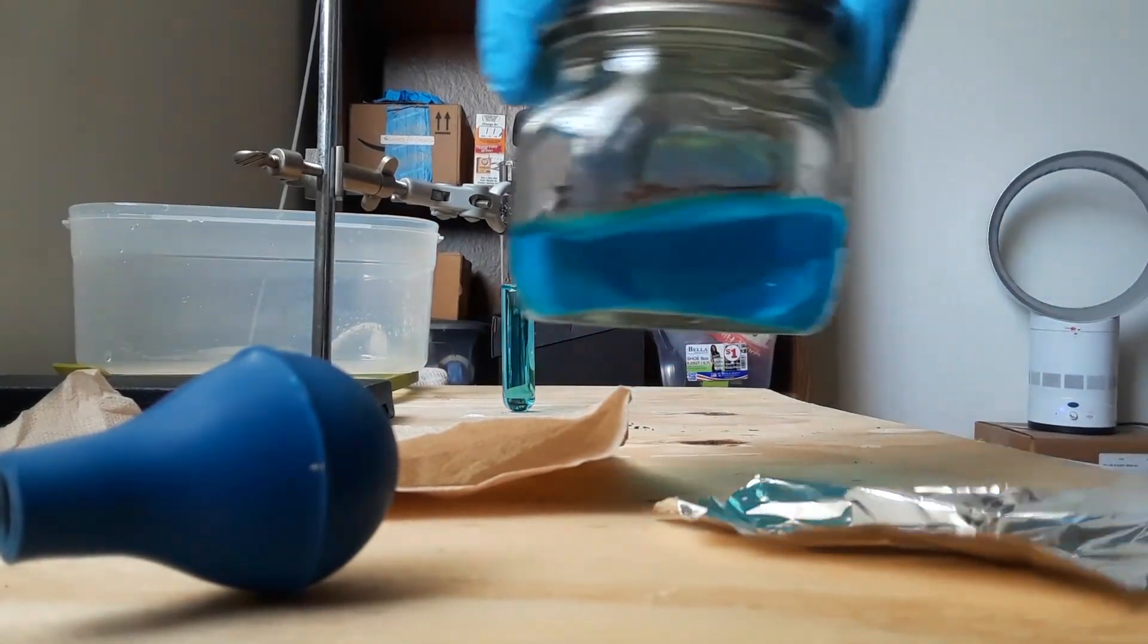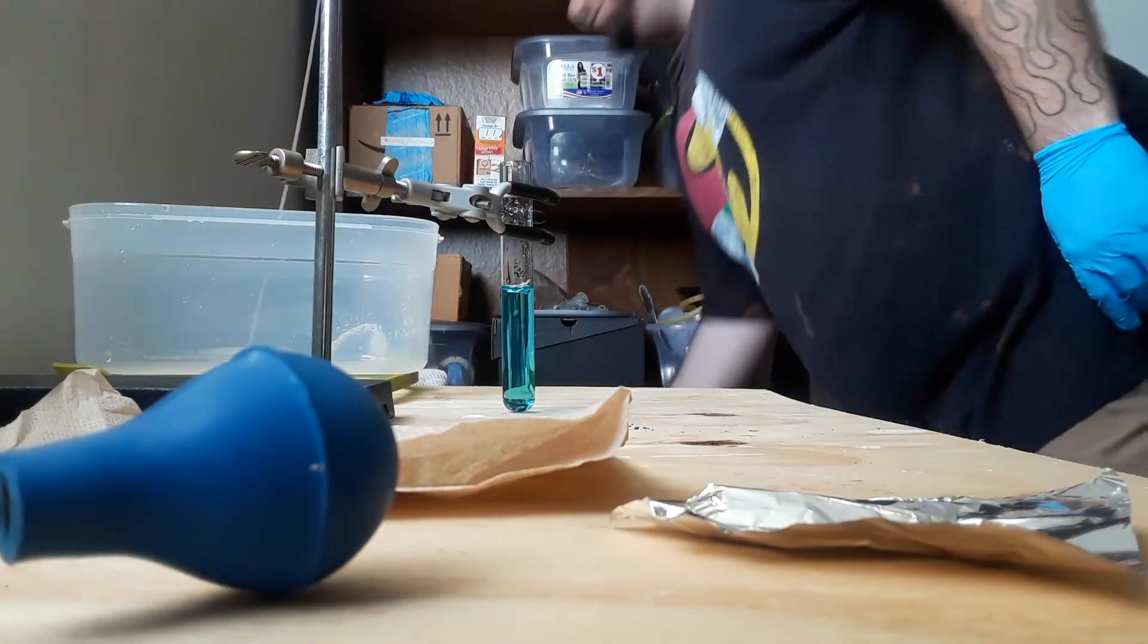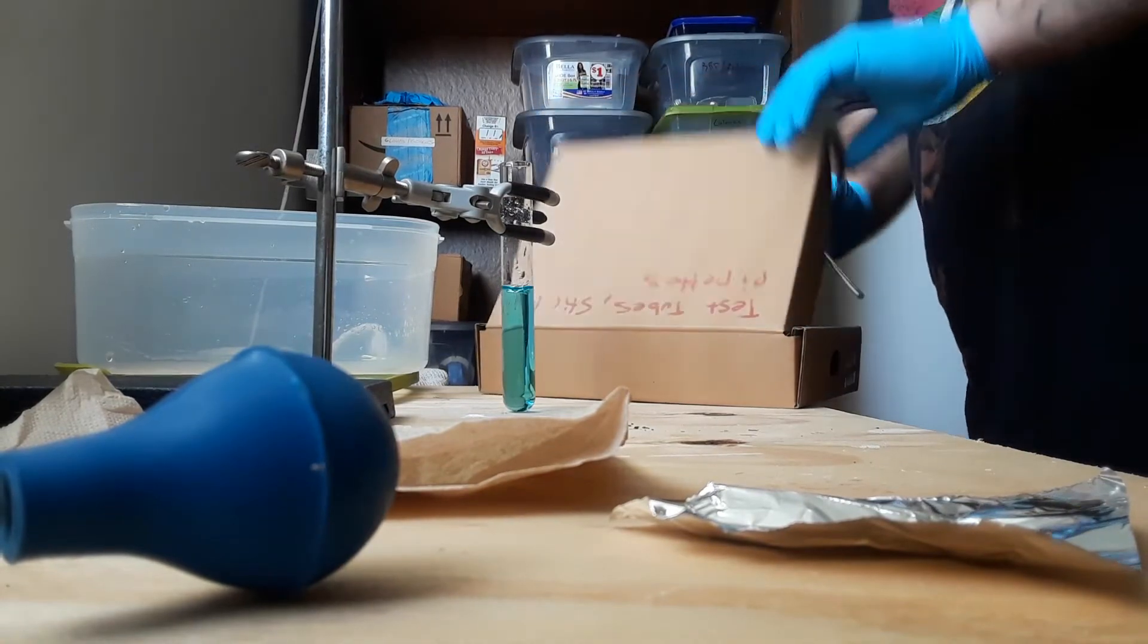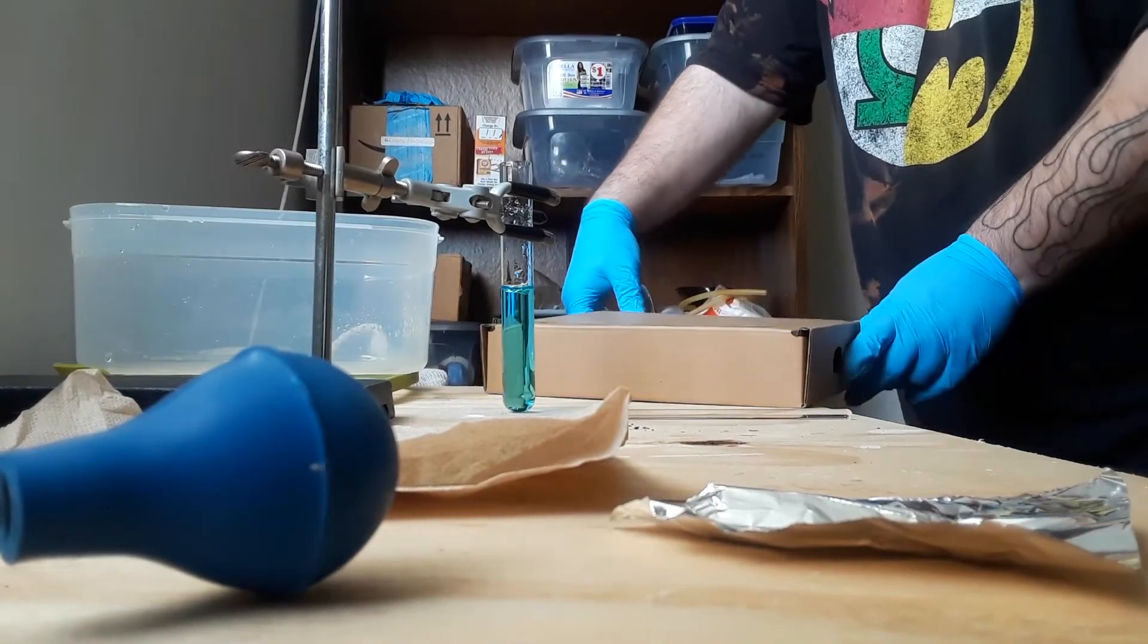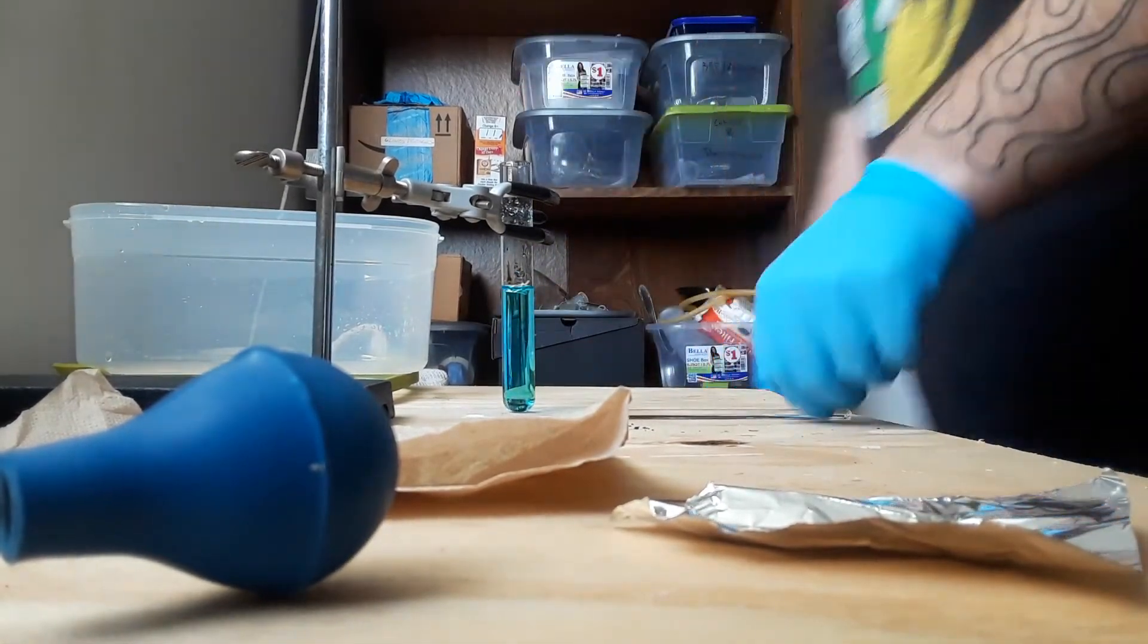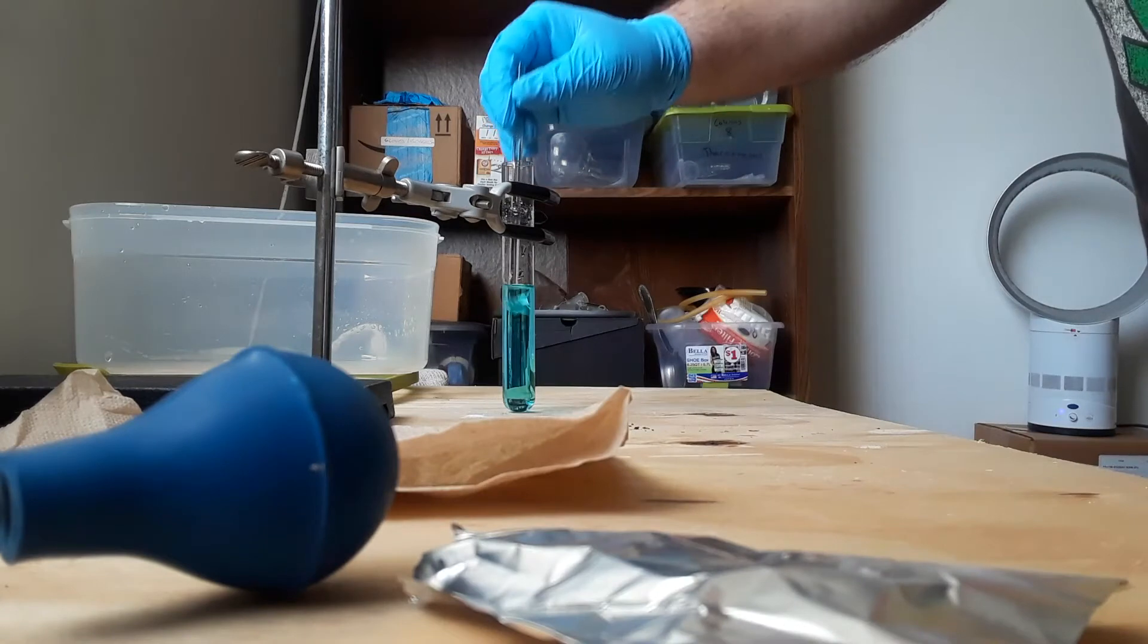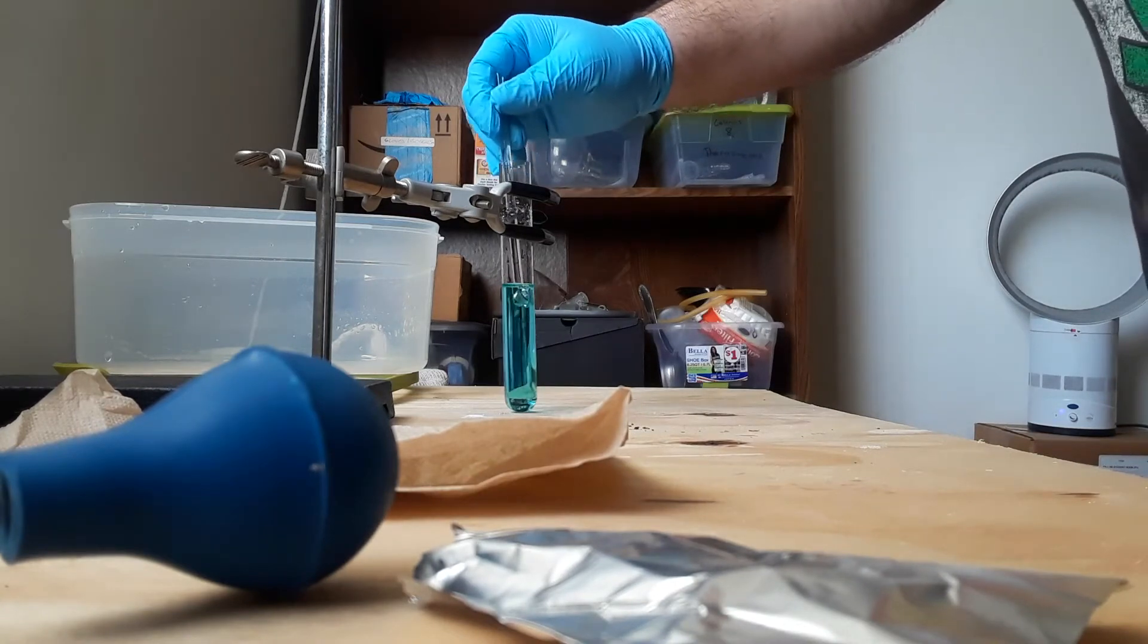I'm going to keep the solution for now. After adding the aluminum foil, nothing really is happening. There might be a passivating layer, some oxide, preventing it from reacting.